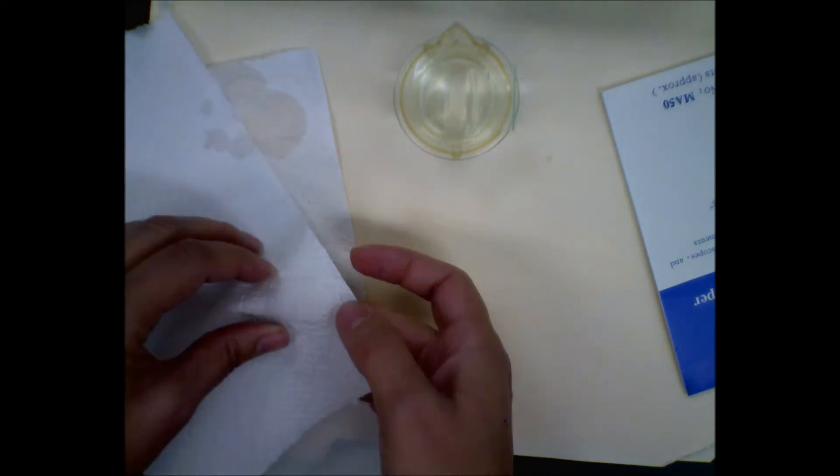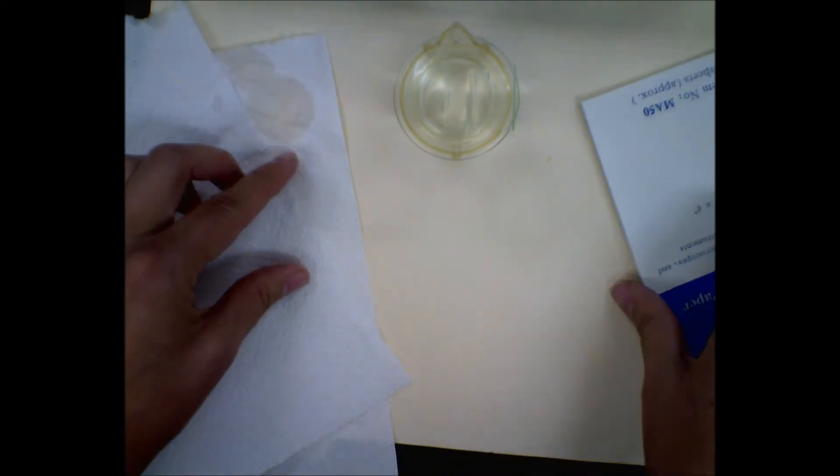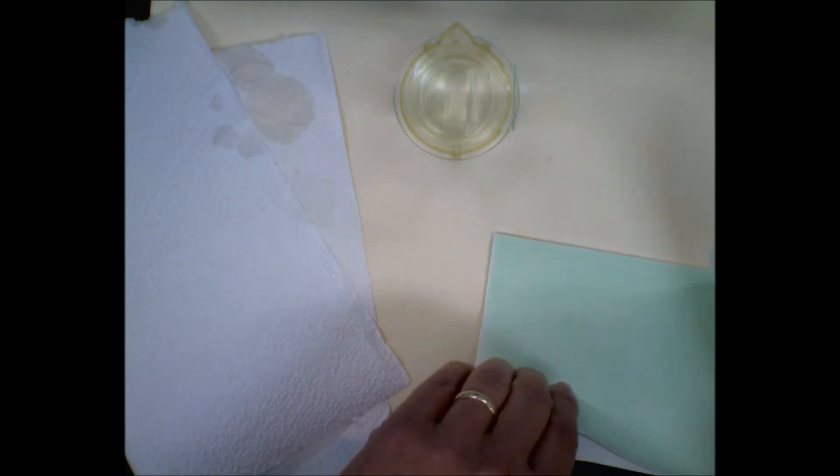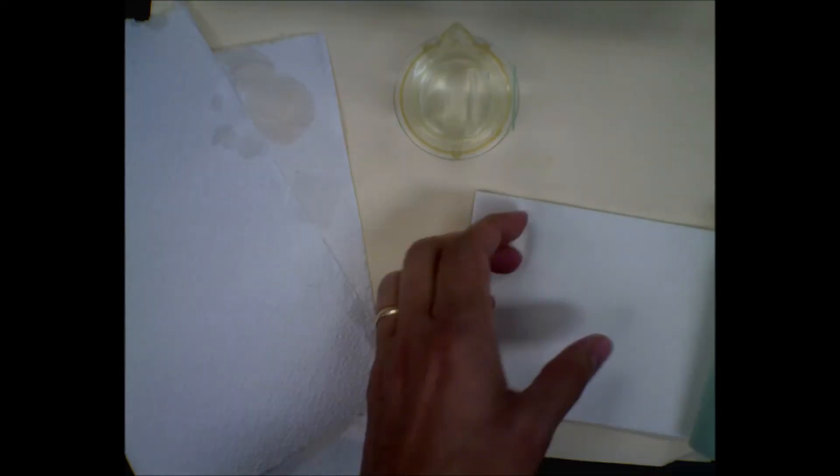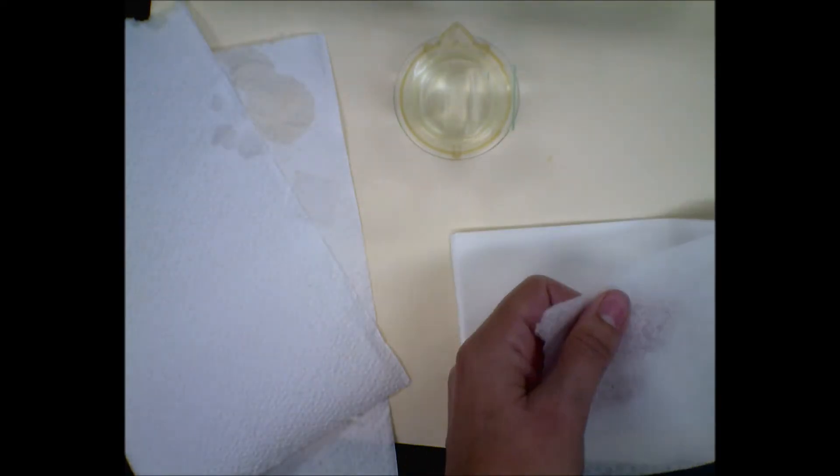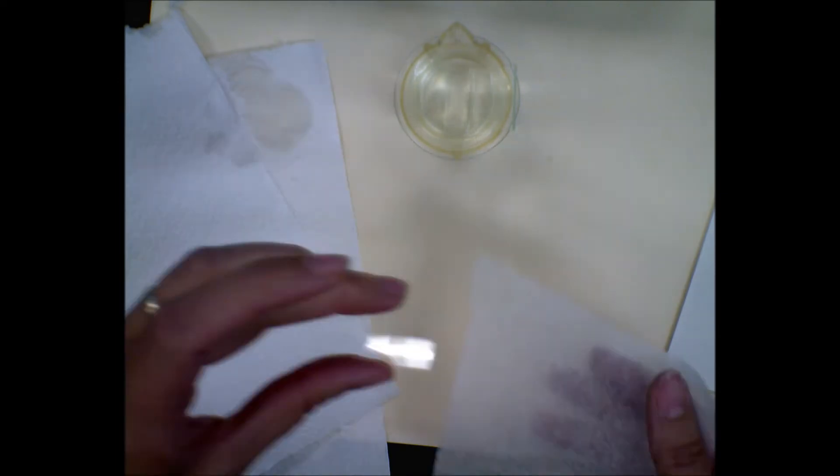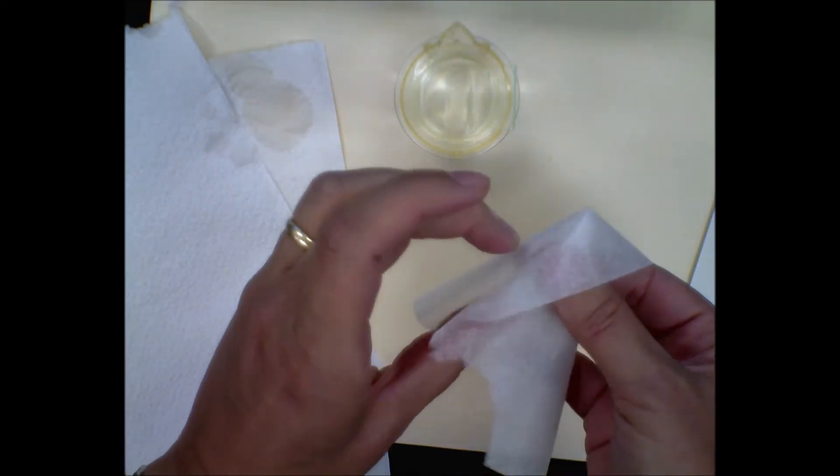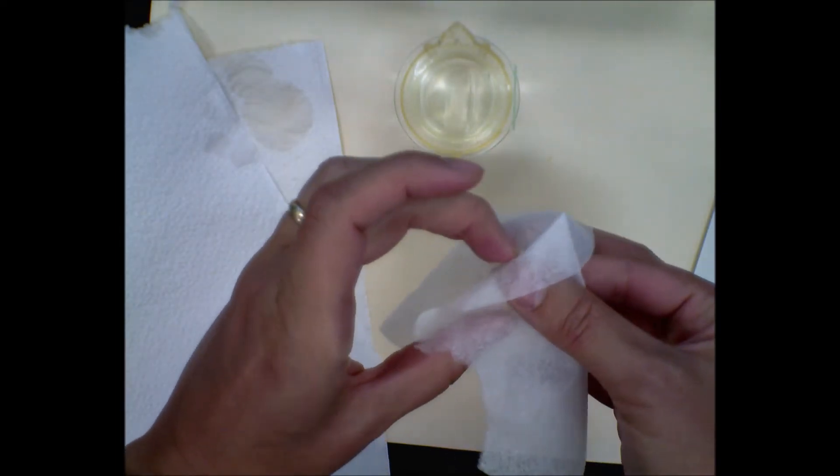Okay, here you can tear out a whole sheet of paper. Make sure you just have one. You don't need a gob of it. Again, try to get the edges of your cover slip, and then just go in one direction.